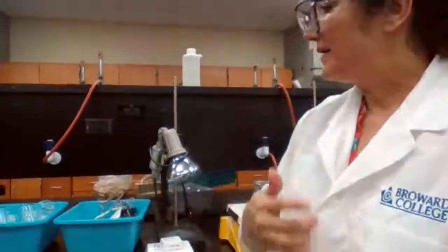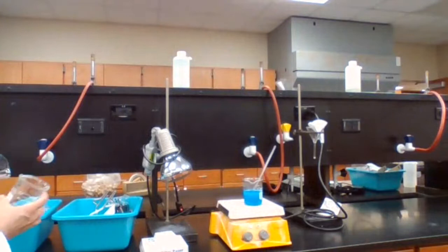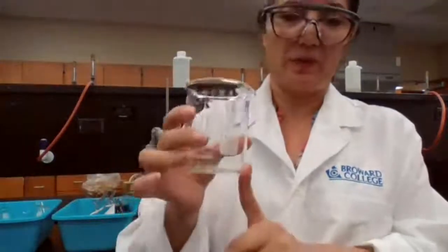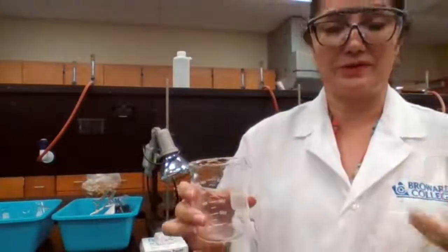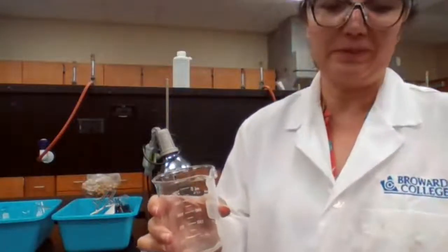and then we do decanting. Decanting is one of the techniques that we did in experiment 3. What is decanting? Let's say you have a mixture of solid and liquid. When you have a mixture of solid and liquid in one beaker, you have two ways to separate the solid from the liquid. Either you set up a filtration apparatus, which we are going to practice today with gravity filtration, in a different step of the experiment.